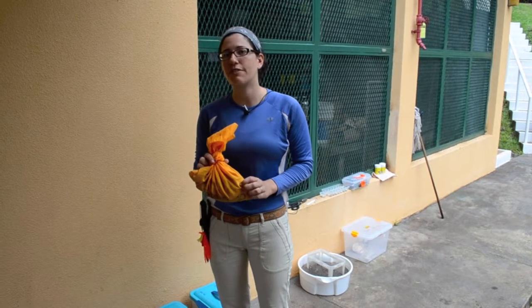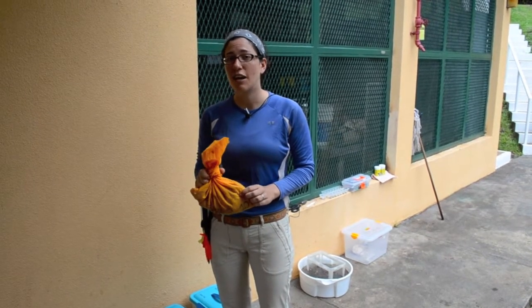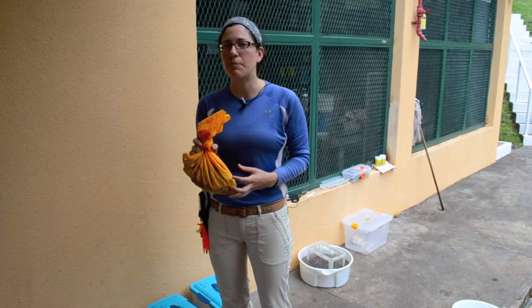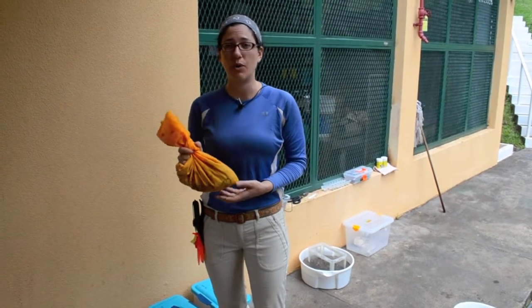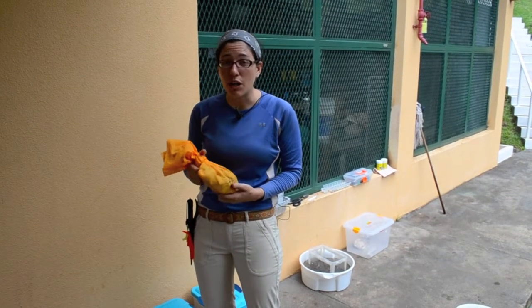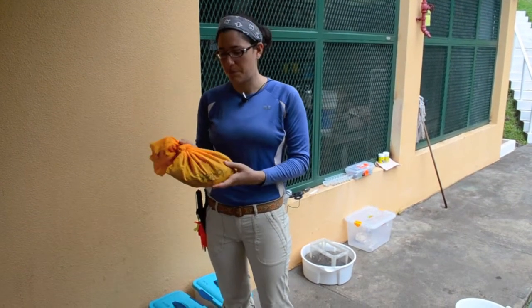The data that we're getting from these is the dry mass of carbon. And if we are taking the dry mass of the whole sample, but there's a lot of soil, soil is heavier than leaves. And so we'll think that there's more carbon than there really is.